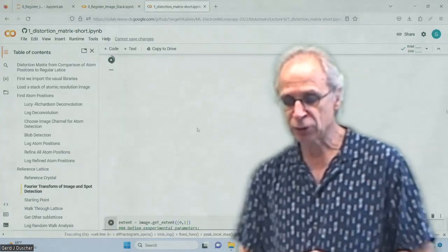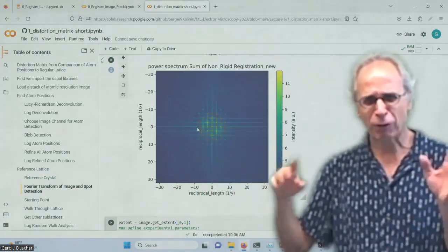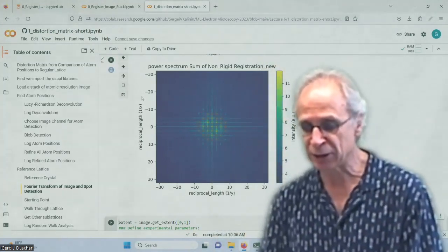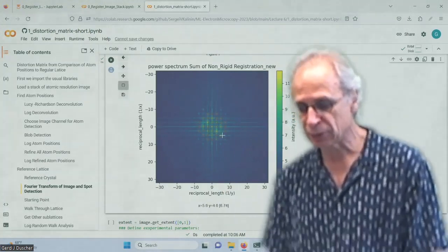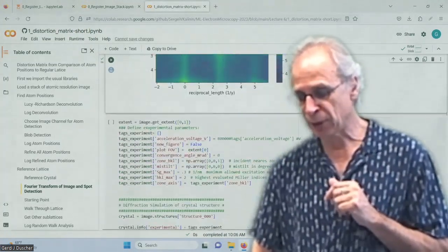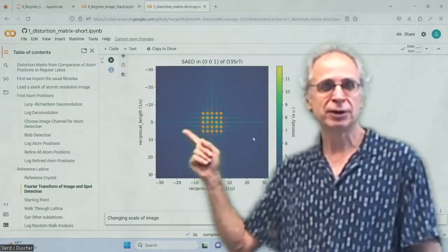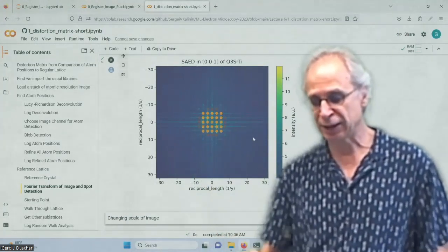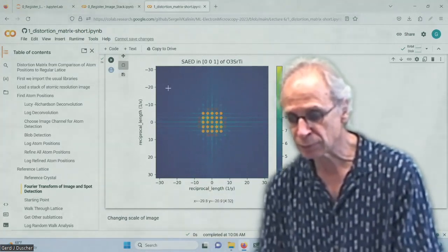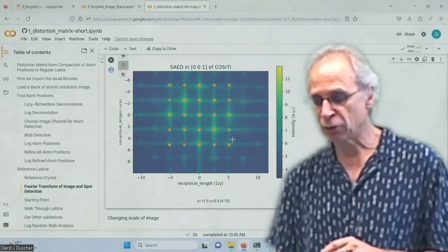What we do now is we want to know in the diffraction pattern. Oh, we did that already, right? So it's all the same stuff we have done already. So you see why I went through that. Now we don't have to worry about it anymore. We just do a blob detection on the Fourier part. And now I do what I did last time. I fit the diffraction pattern of strontium titanate onto these experimental ones. So the orange ones are that.